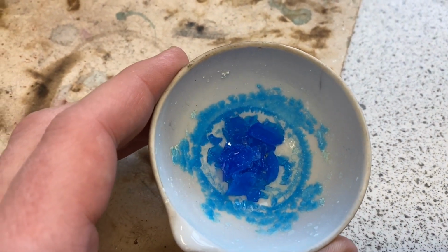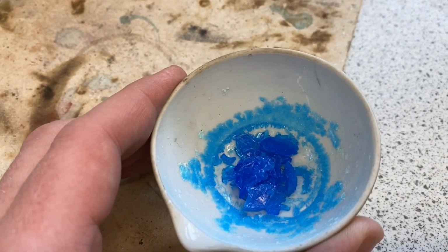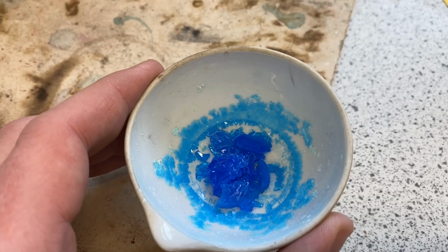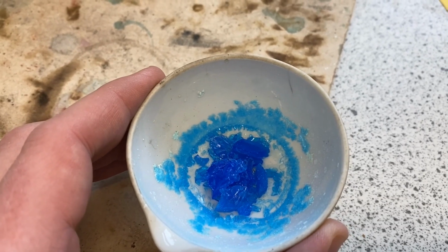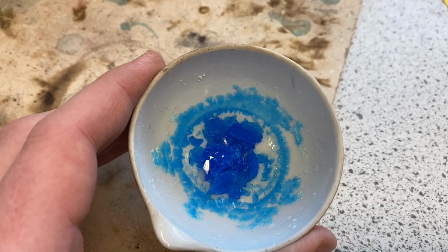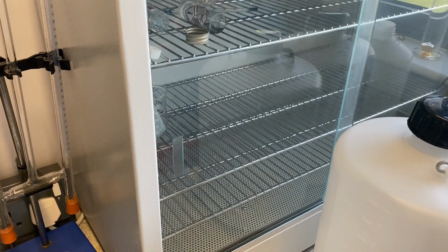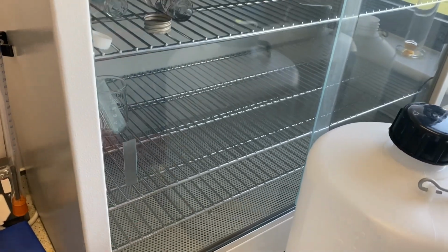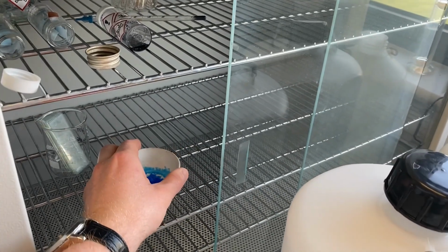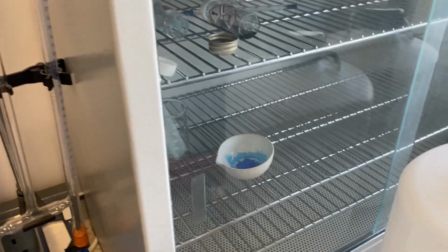This is a few days later from the original video. Beautiful shiny crystals of copper sulfate. And the next stage is to dry them off by patting them down with some tissue paper and putting them in an oven to dry completely, so that we've got a clean, pure, dry sample of copper sulfate. So here is our chemical oven at school. I'm going to open the door here, place our evaporating basin inside, and leave them to dry.